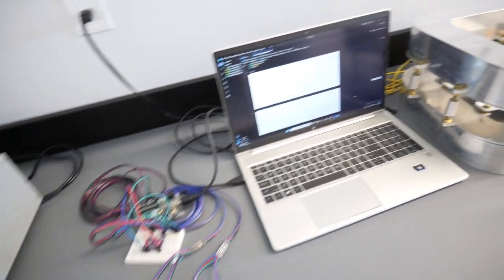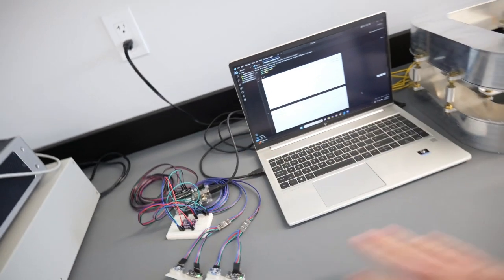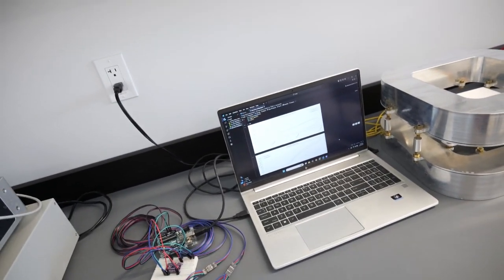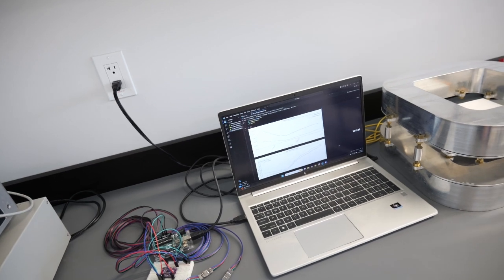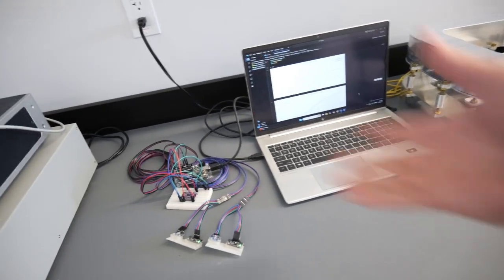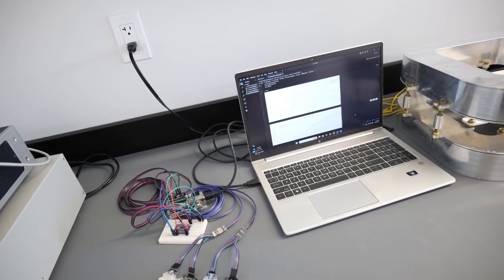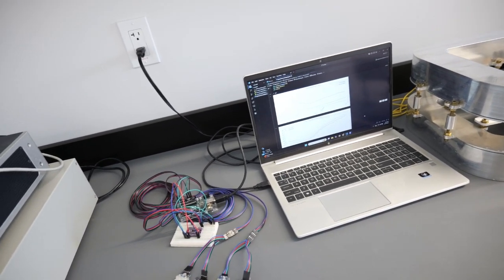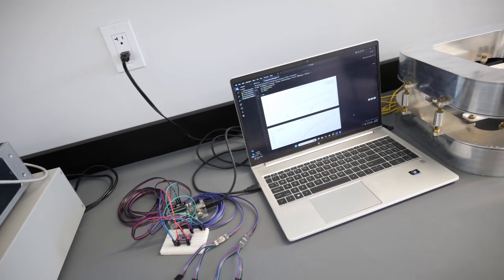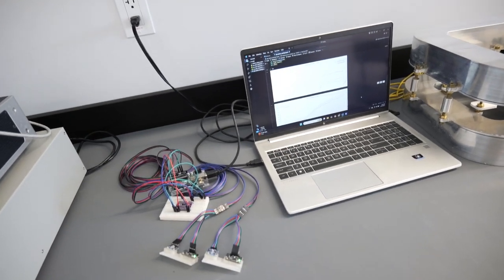But yeah, so this is the setup, and I have been testing it here, and I'll leave it running overnight to see if everything runs smoothly for a long period of time. But other than that, I'll take all of this with me to Maryland, and we'll do a proper calibration when we put actually the equipment in the final place where we are going to run the experiments.